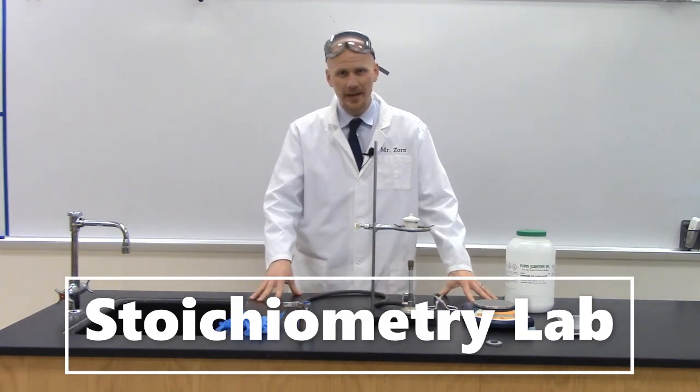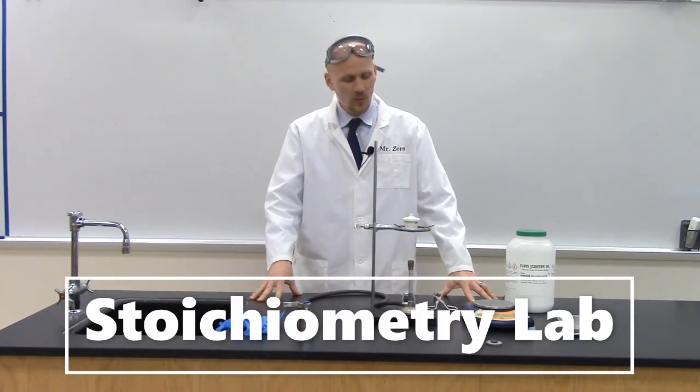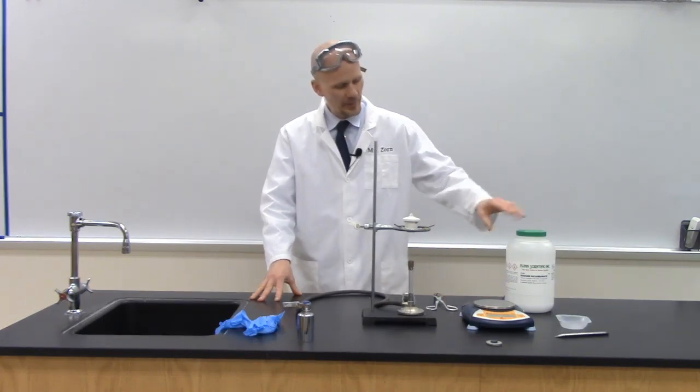Hi, I'm Mr. Zorn and this is the Stoichiometry Lab. In this lab we're going to be looking at the thermal decomposition of sodium bicarbonate.